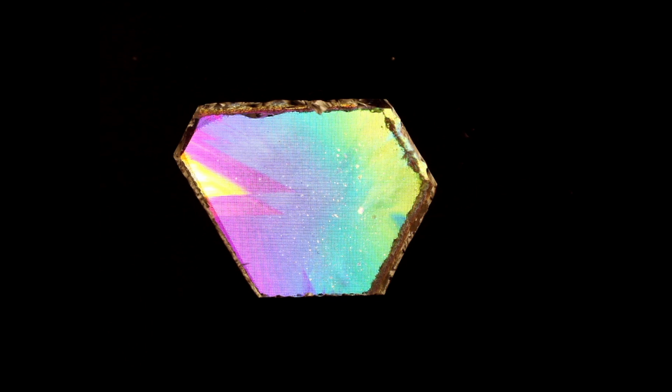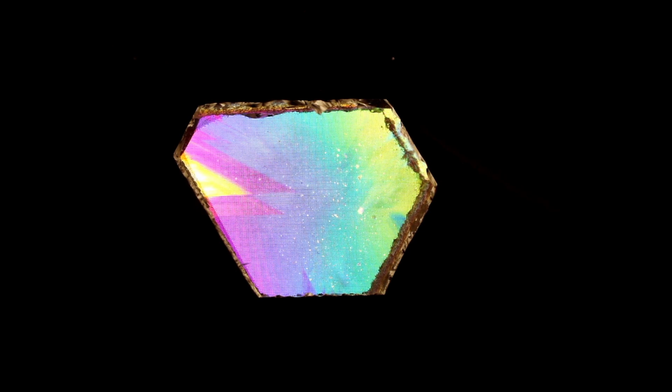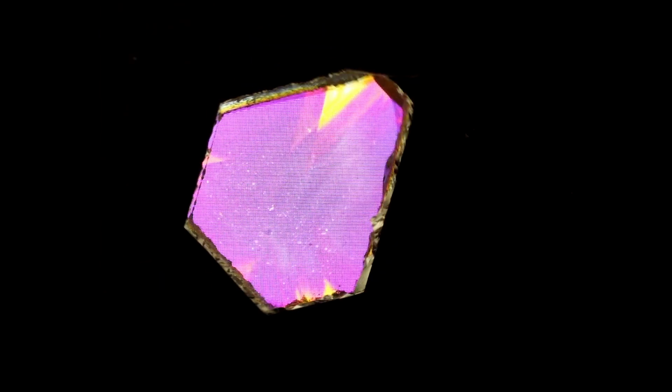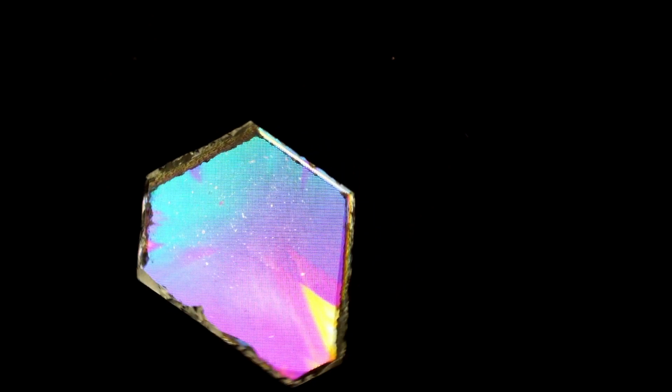Let's rotate our quartz crystal now with crossed polarizers and see if anything else interesting happens. Remember, if we were looking at a normal uniaxial material, when we were rotating it with crossed polarizers in this viewing direction, it would stay at extinction the entire time. However, with our quartz crystal, we're seeing a manifestation of quartz's optical activity, along with my failures as a lapidary for not cutting everything perfectly aligned with C.